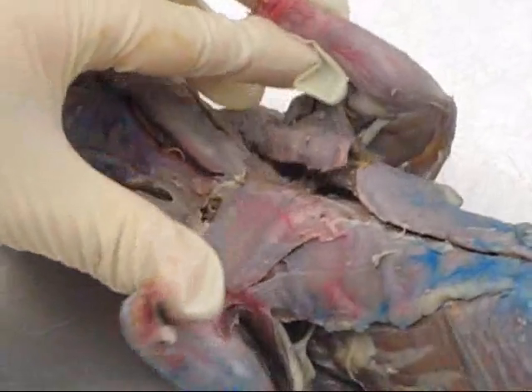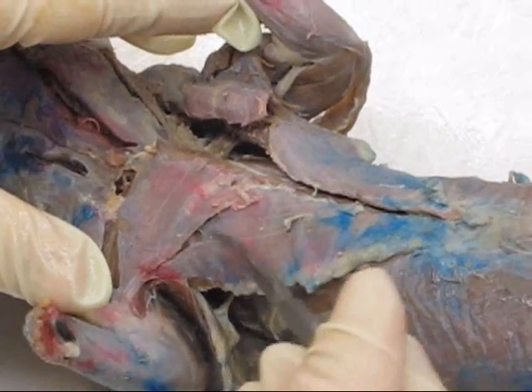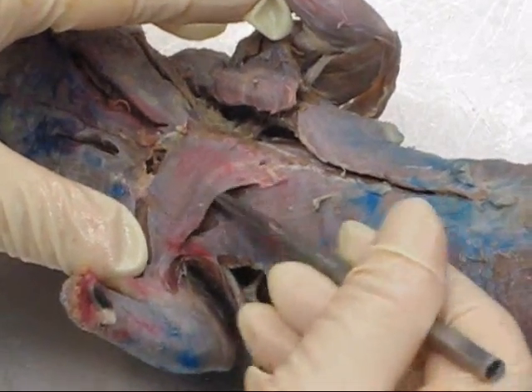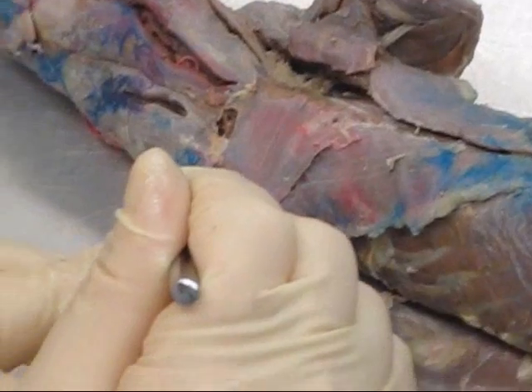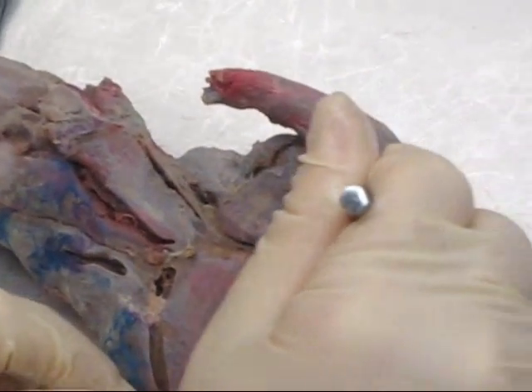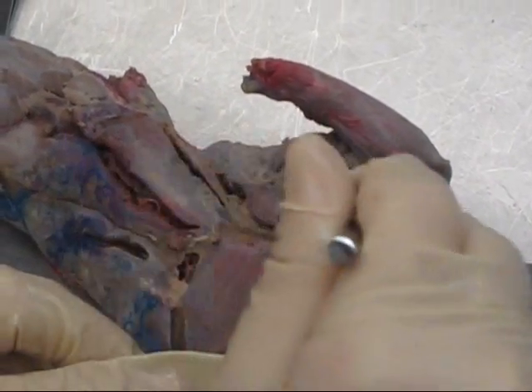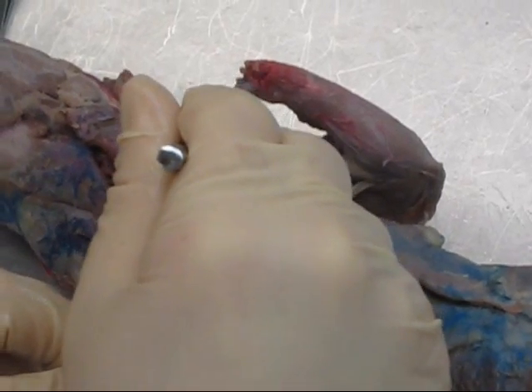In the mink's chest region we have a couple different muscles. Right in here is pectoralis minor, pectoralis major, and then up here in the mink's shoulder, this is clavodeltoid. You can see them on this side where they've all been cut. Again: pectoralis minor, pectoralis major, and right in here is clavodeltoid — so one, two, three muscles.